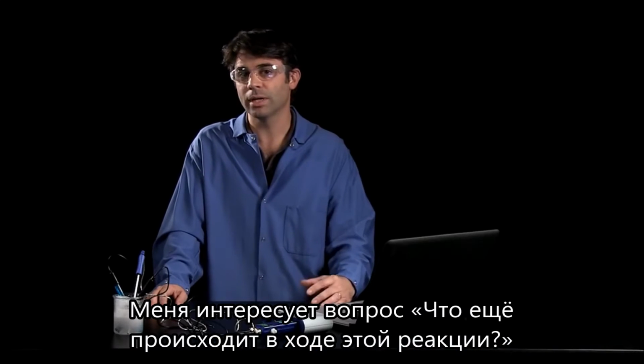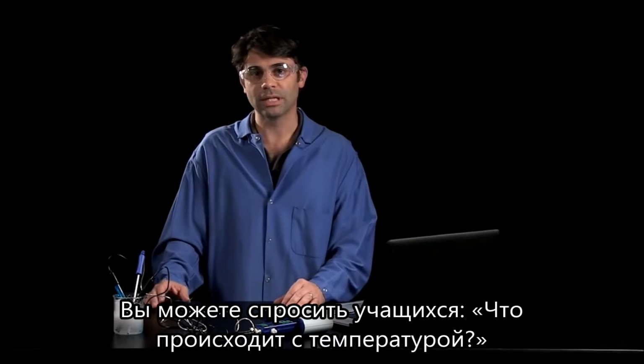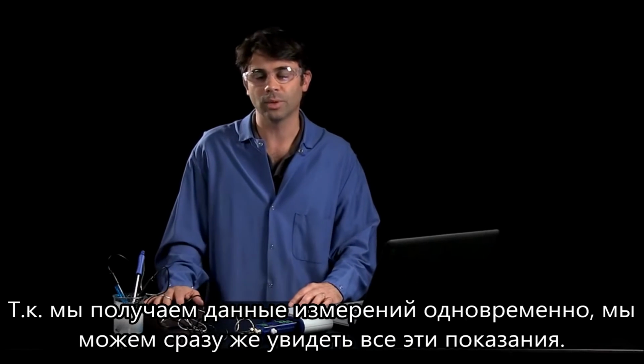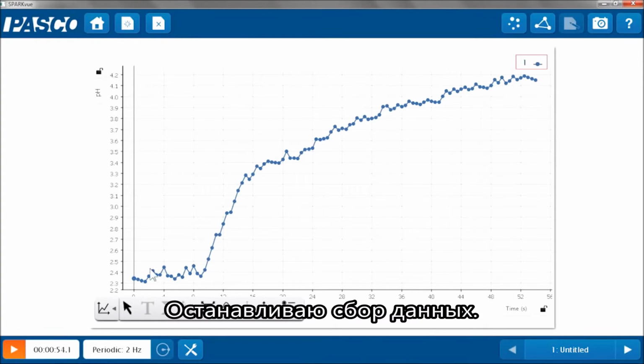But now the interesting question is, what else is happening in this reaction? So you can ask your students, what's happening to the temperature? What's happening to the conductivity? And now, because of the simultaneous measurements, we can see all of that at once. So let's take a look. I'm going to stop my data collection.